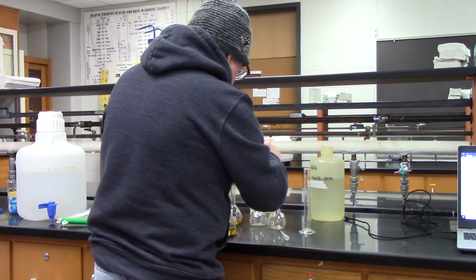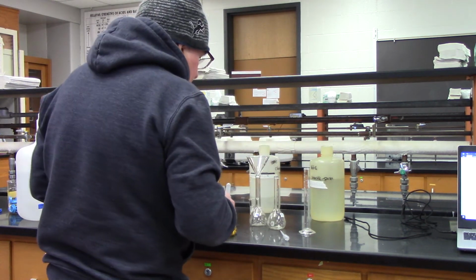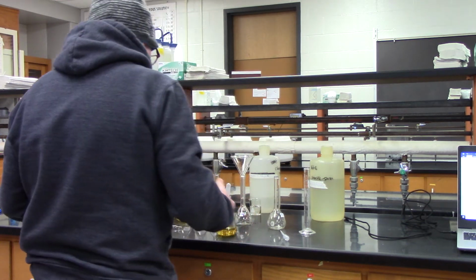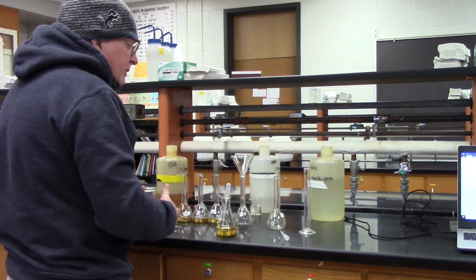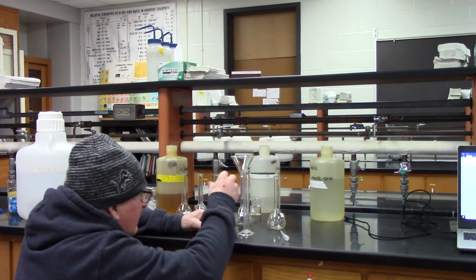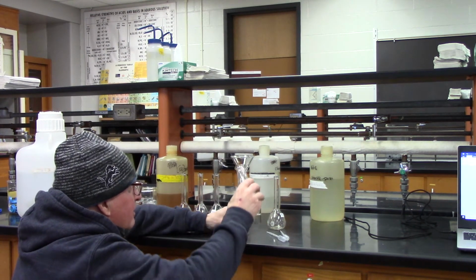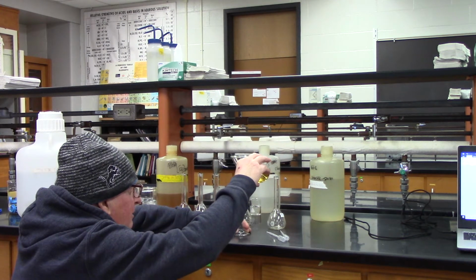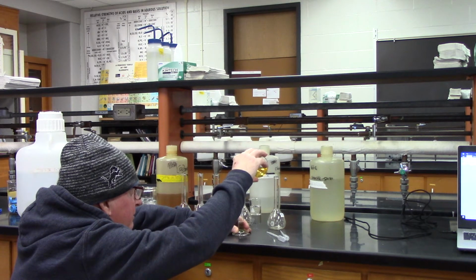So when you do this rinsing and etc., this is called being quantitative with your work, okay? And you want to be as precise as you can, and there's always better ways, more and more ways to be precise. One would be use a better measuring device than a graduated cylinder. But I've decided to use this.